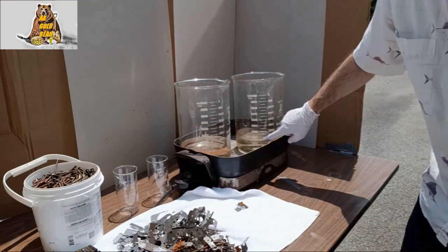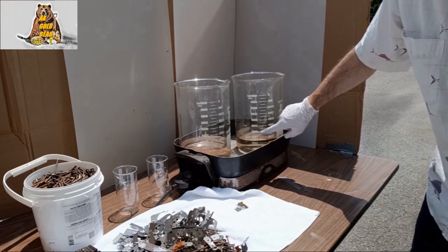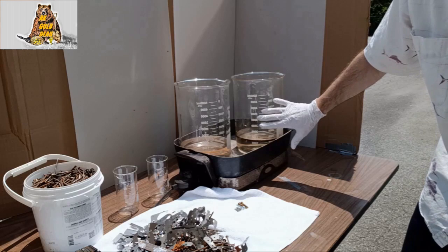1,000 ml of water and 200 ml of sulfuric acid. Now I have battery acid, electrolyte.